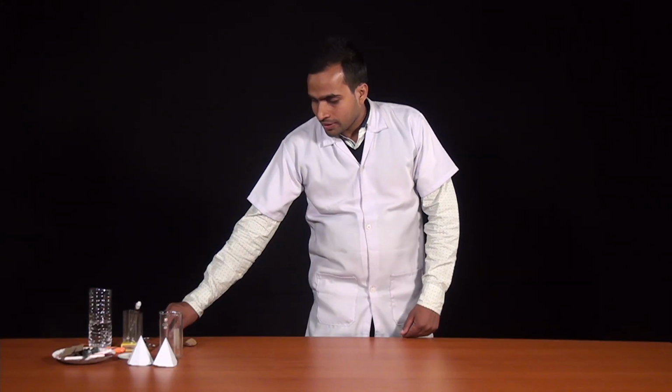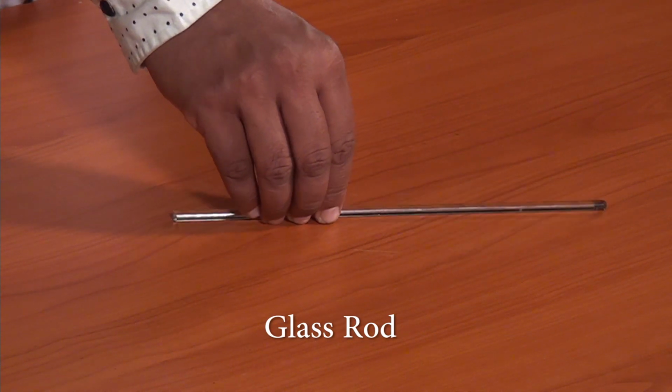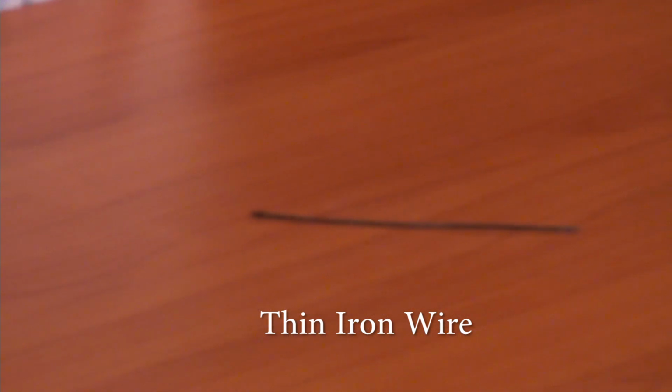For the first activity, we have collected certain materials, such as this glass rod. This glass rod is collected from our science laboratory. We have collected another material. You can see that this is iron, a thin wire of iron. You can collect this iron from your home, and different household substances can be used for this activity.